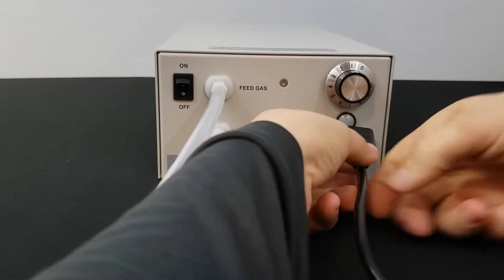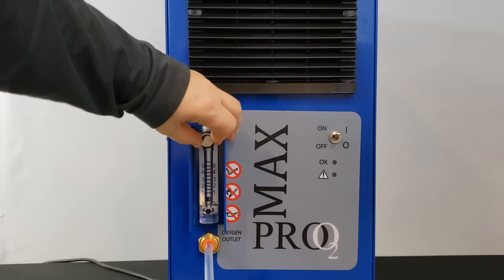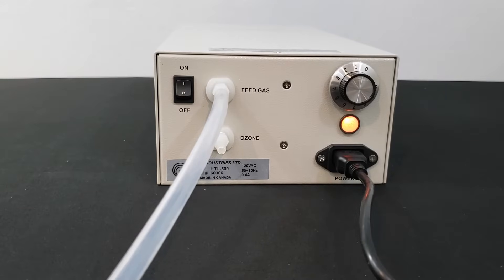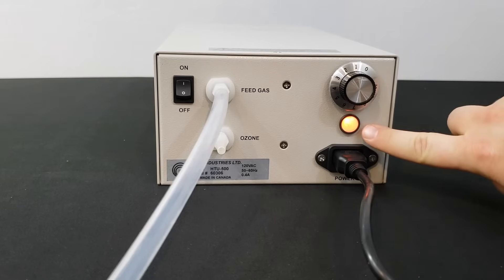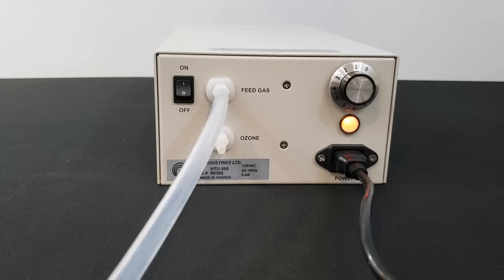To create ozone, you plug in the unit, start the flow of feed gas, then turn the HTU 500 switch to on. The orange light indicates that the unit is powered on. The HTU 500 makes a distinctive noise while operating — this is normal and means everything is operating correctly.